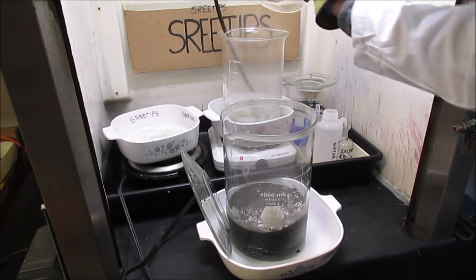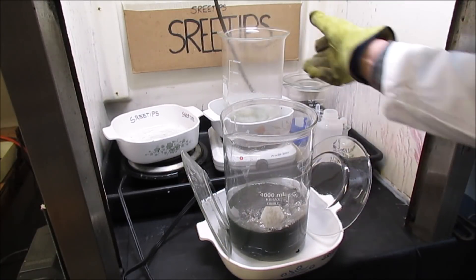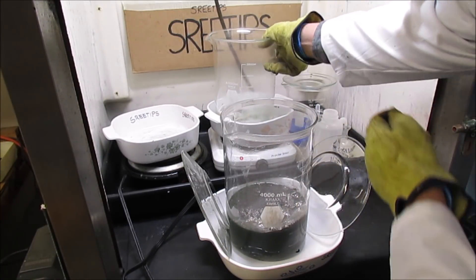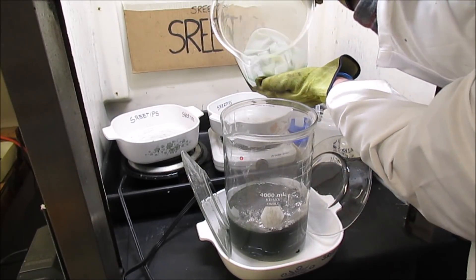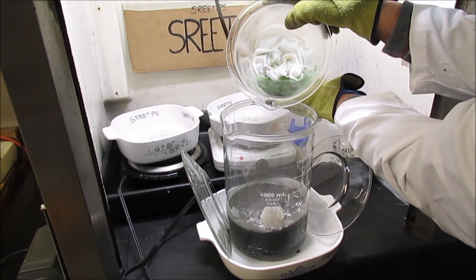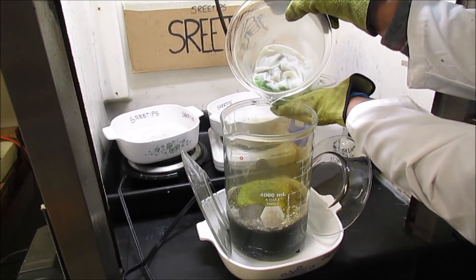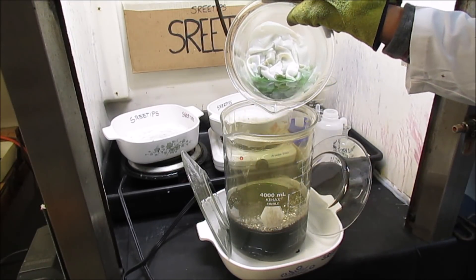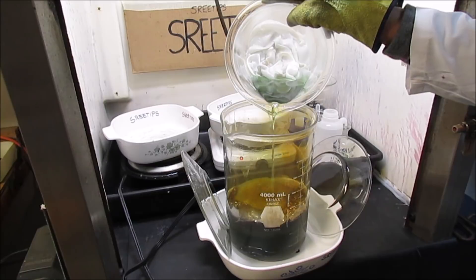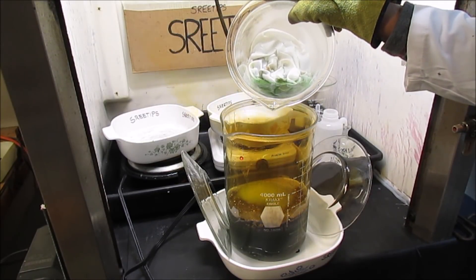And I'm going to take this one back here that's been boiling the filters and pour this solution right in with this other mixture here. I get a good reaction here if you've seen that. This is real acidic, so we've got to kind of be careful. Both solutions are real hot.